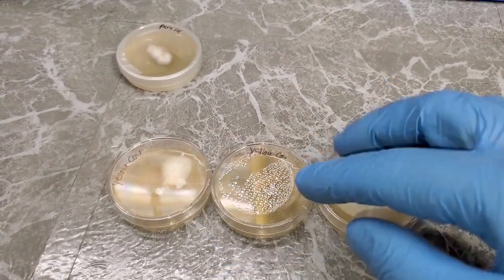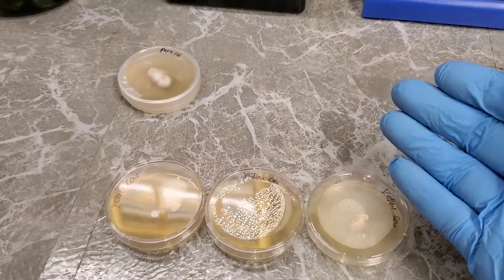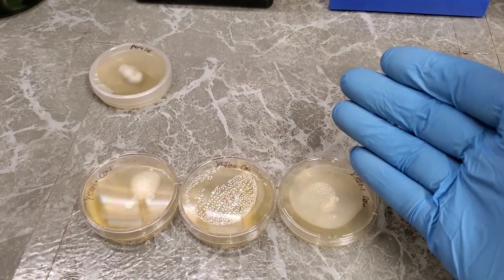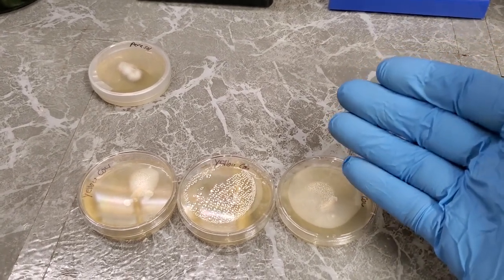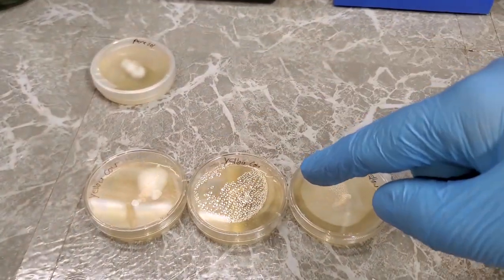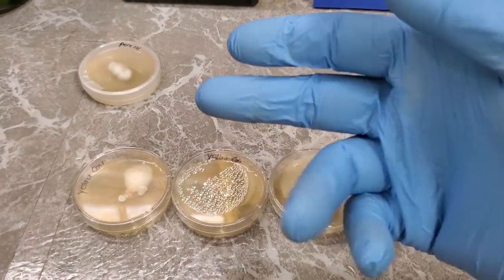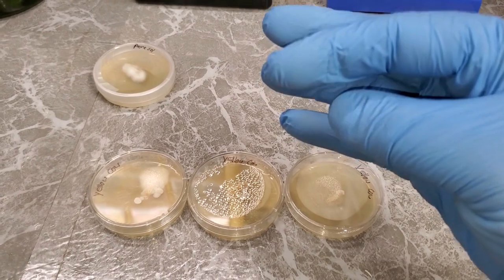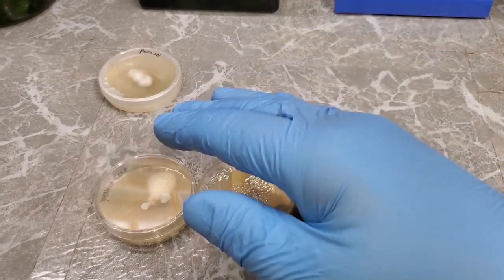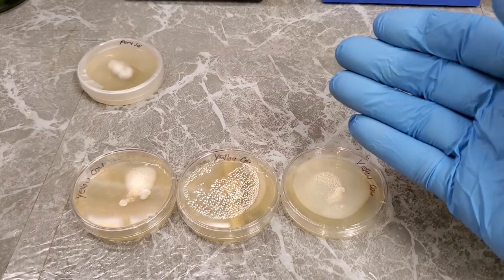And one thing that happens very frequently with wild mushrooms is even though the fruit body itself may look perfect to the unaided eye, it's very possible that at one point during its growth cycle, an insect or something bore through the point where you were taking the tissue sample from, and while it was boring through that mushroom, it dragged in bacteria or yeast or mold spores or whatever, any kind of microorganism that the mushroom could then just close itself around and encapsulate but not completely kill off. So it's very, very common for even the insides of wild mushrooms to contain contaminations, and that's something you're just going to have to deal with.